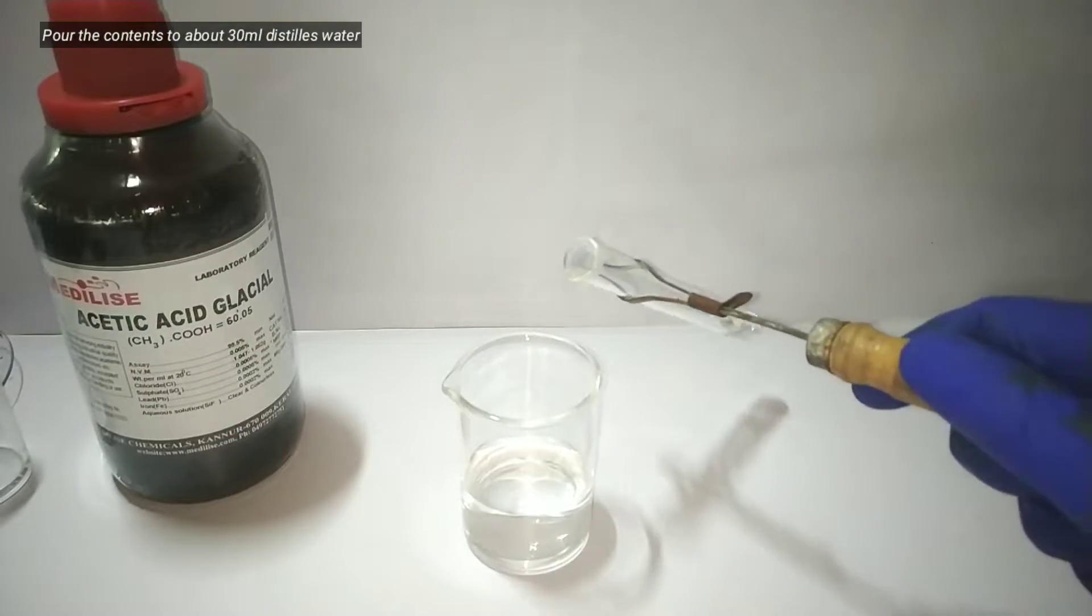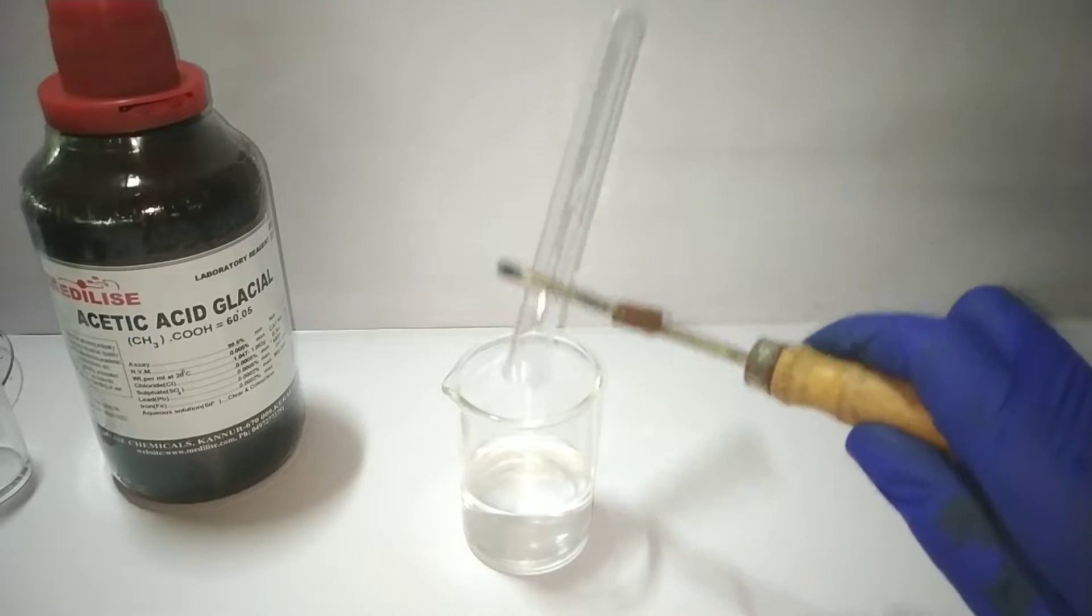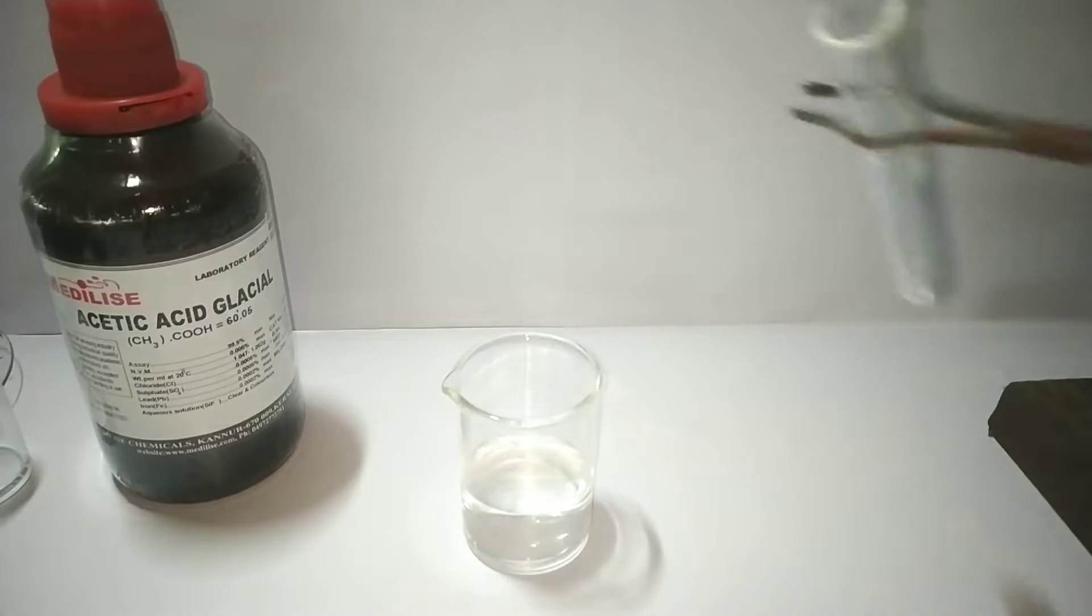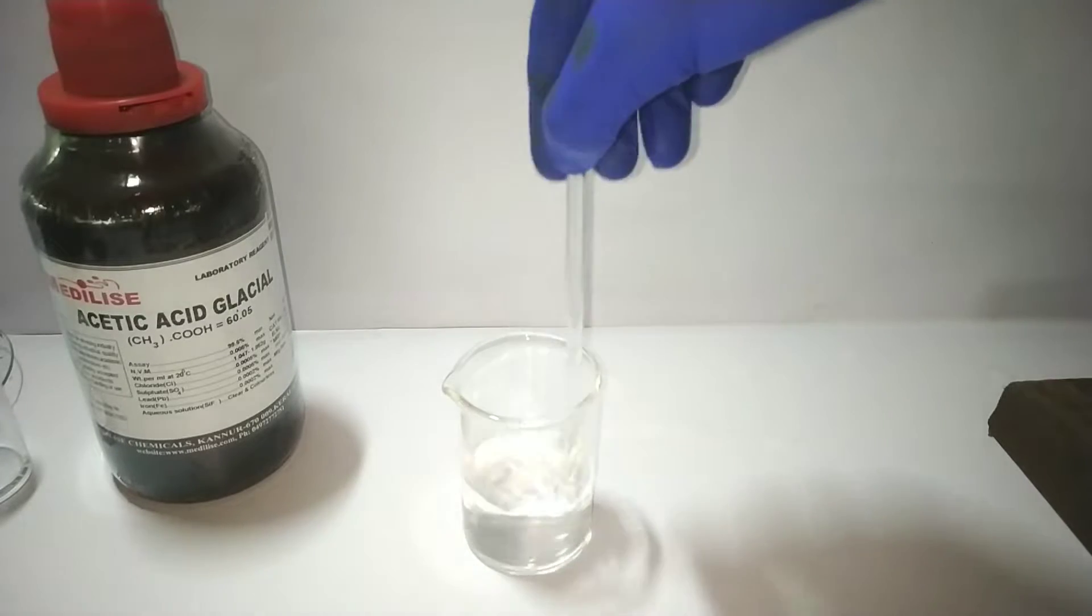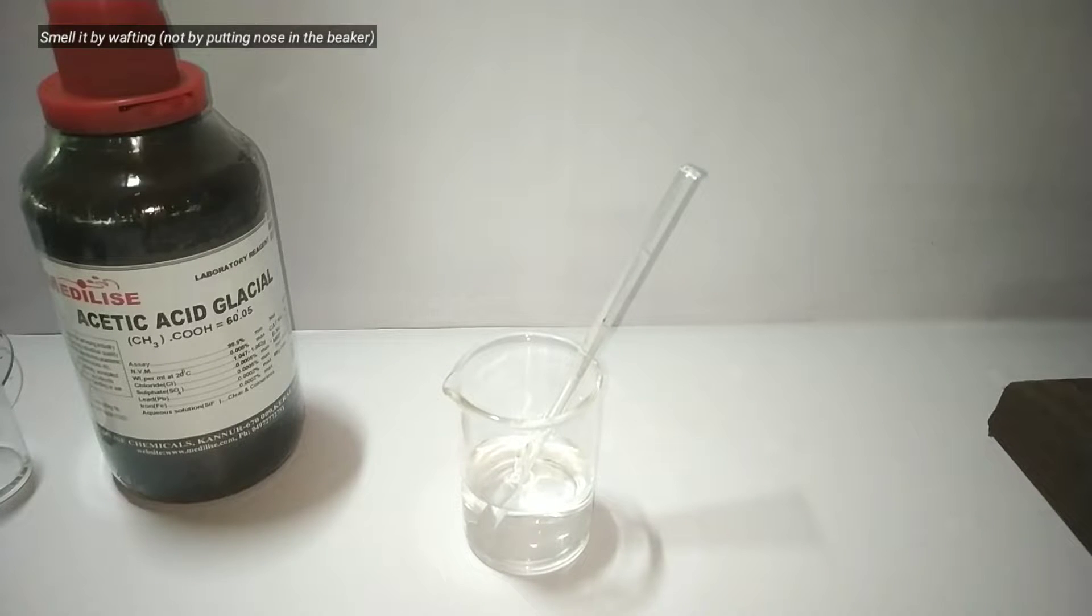The contents of the test tube are then poured into 30 milliliters of cold distilled water. The fruity smell of ester can be identified by gently wafting the air from the beaker to the nose. Do not directly put your nose in the beaker.